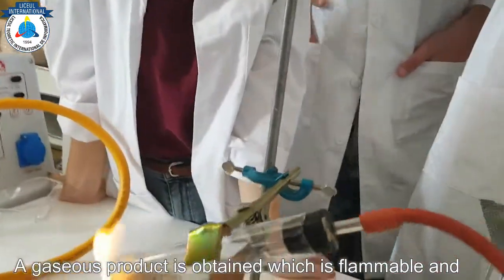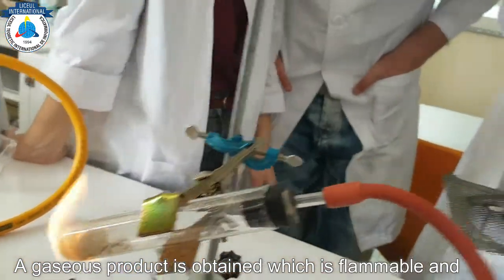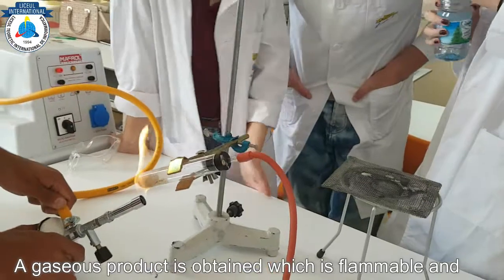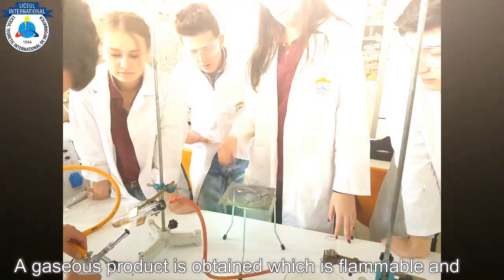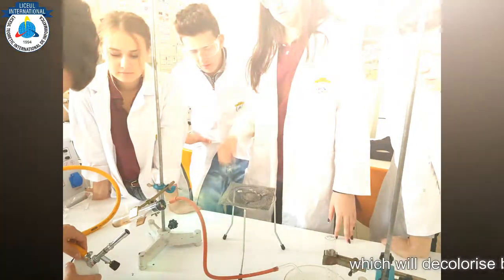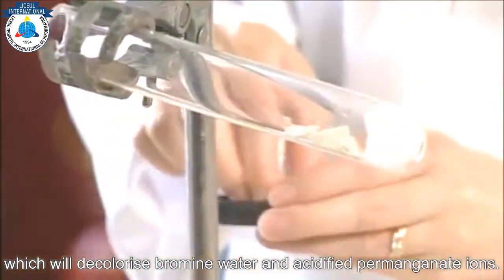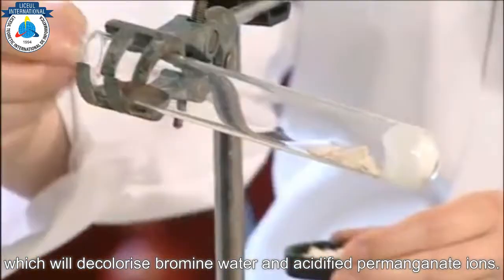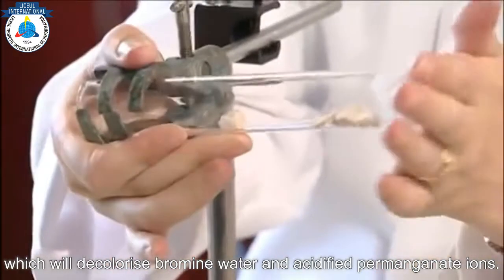It's not melting — it's silica-based — and they mimic the silica and alumina based catalysts that are used in industry. Now you want this tilted, but not so much so.